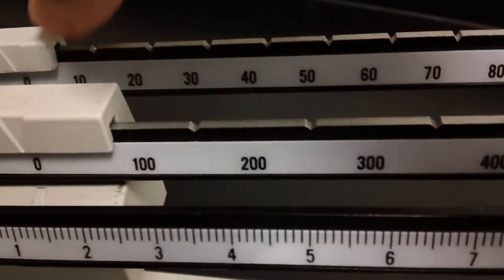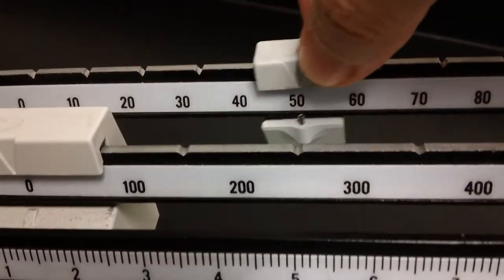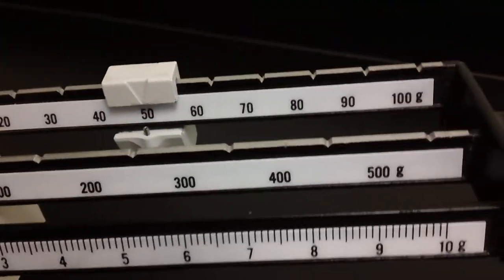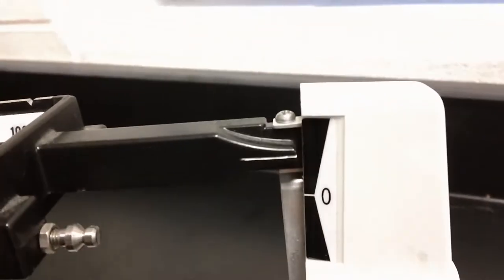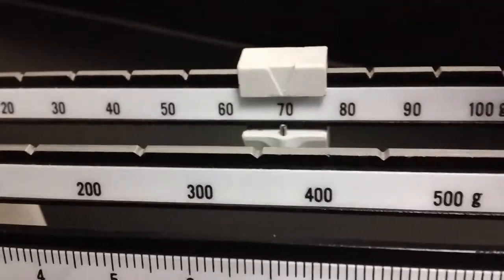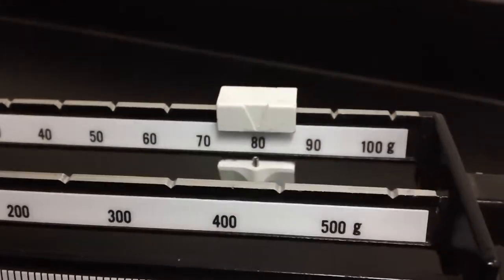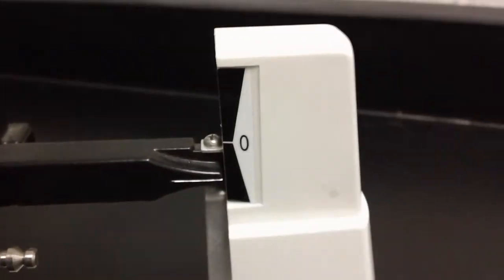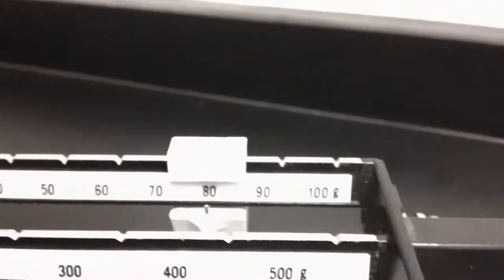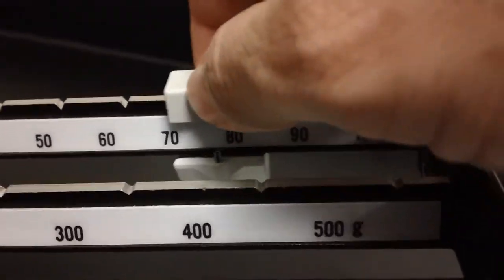And now I'm going to use my tens of masses. I'm going to slide it up to 50, because I'm just taking my best guess. As you can see, that 50 is not enough mass. So I'm going to keep going up, up, up. All right. Now, the 80 is too much, so let's slide it back to 70 and see what happens.